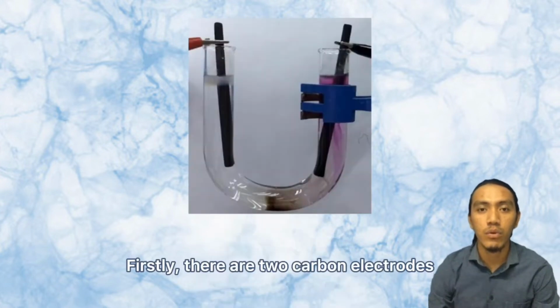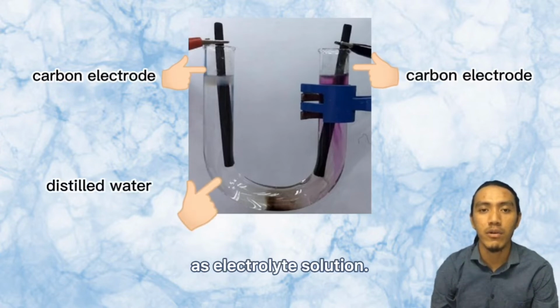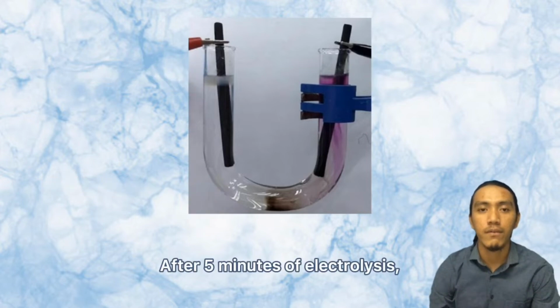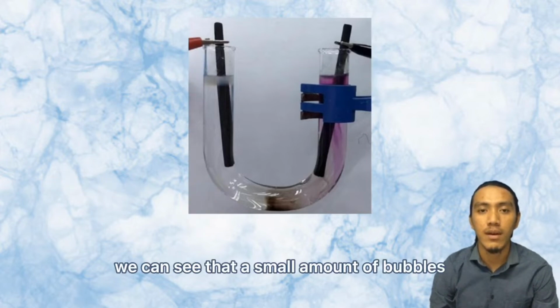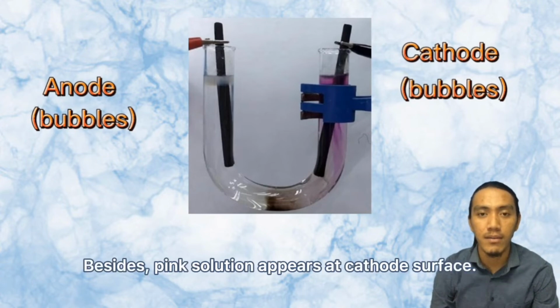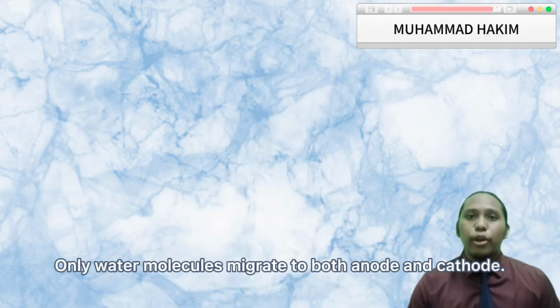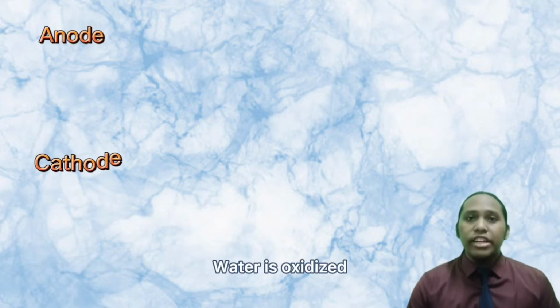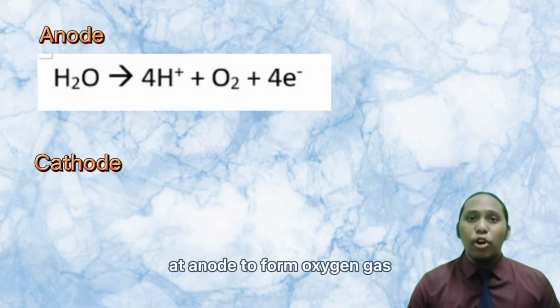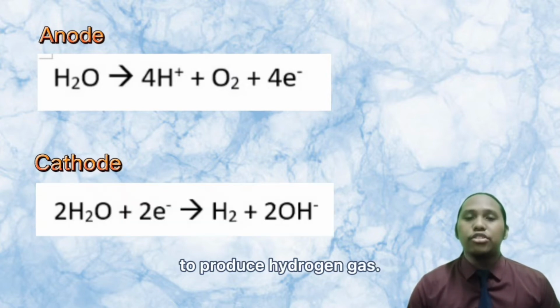Firstly, there are 2 carbon electrodes immersed in distilled water as the electrolyte solution. After 5 minutes of electrolysis, we can see that a small amount of bubbles form at the anode and the cathode electrodes. Besides, a pink solution appears at the cathode surface. Only water molecules migrate to both anode and cathode. Water is oxidized at the anode to form oxygen gas, while water is reduced at the cathode to produce hydrogen gas.